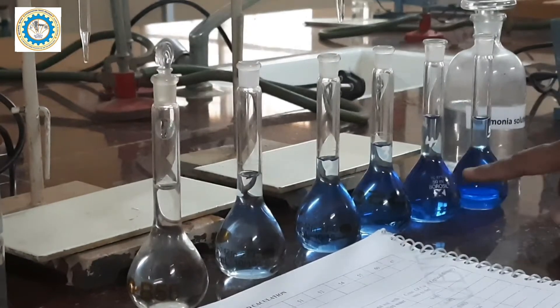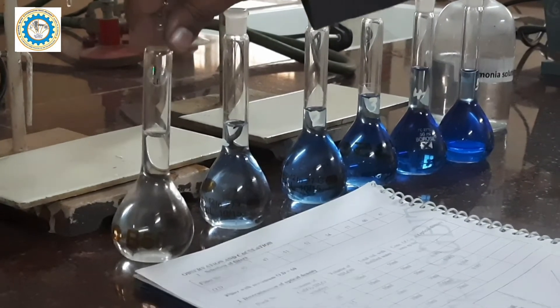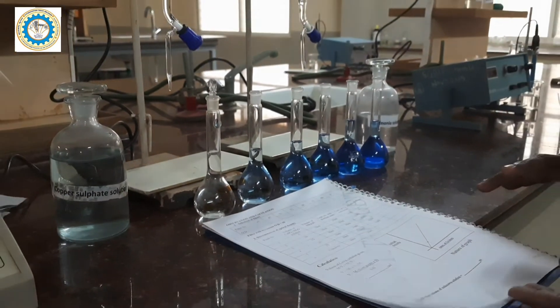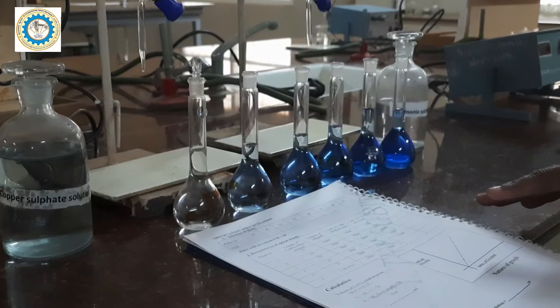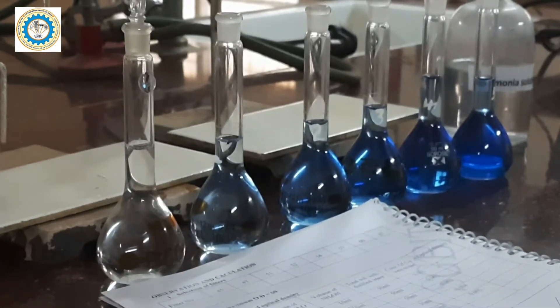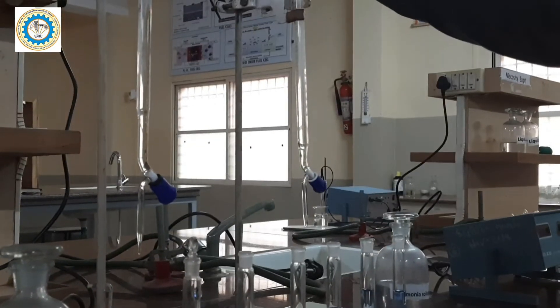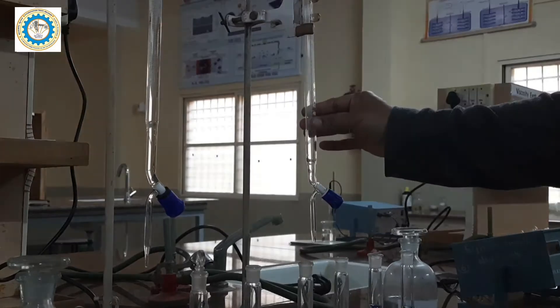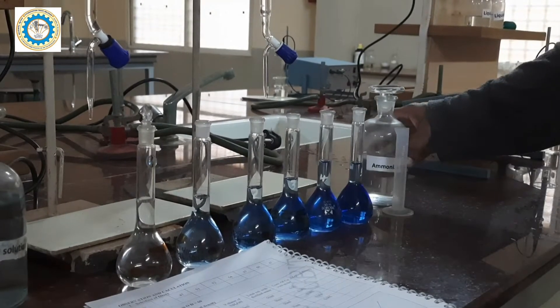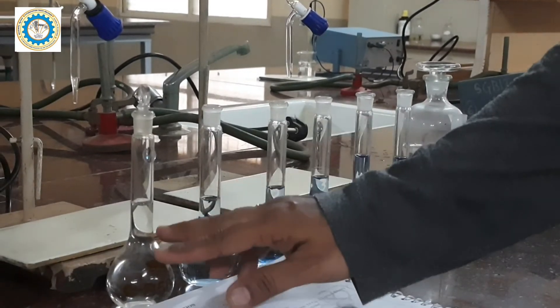For all these bottles, we have added 10 ml of ammonia and the remaining quantity of water. Along with that, we have prepared one more solution called the blank solution. The blank solution is used to calibrate the instrument. We fill the copper sulfate solution in a burette, take water in another burette, and use a measuring cylinder for the ammonia. By doing this, we have prepared all 5 solutions along with the blank solution.